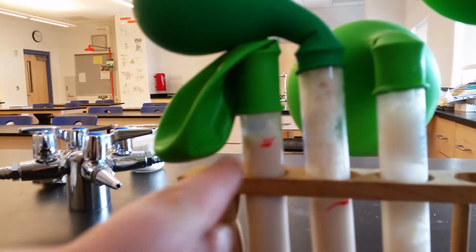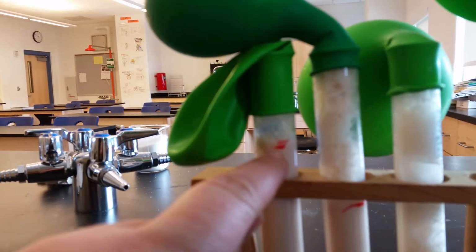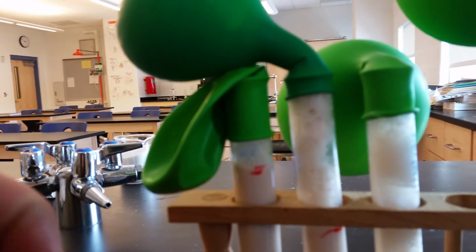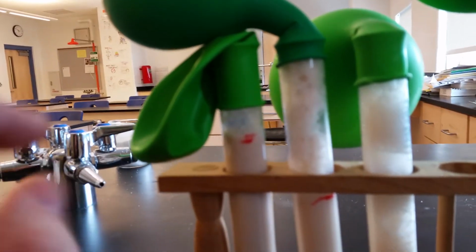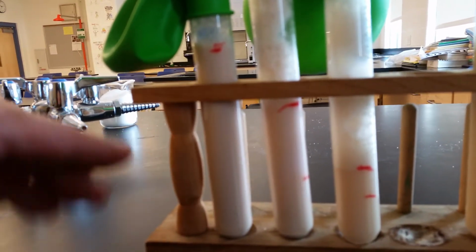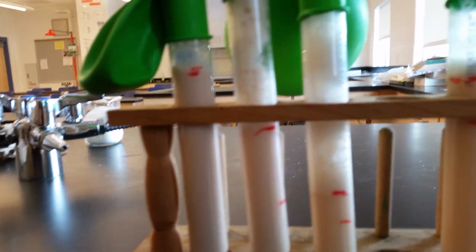Test tube A is not really bubbling anymore at all. If you look really closely, it's kind of hard to see it. I can't get it to focus. But the red line was for 30 minutes, and then that red line just above it is where the bubbles are now. So the bubbling has pretty much, and if you look down in the test tube, there's no bubbles rising. So the active bubbling has completely stopped there.